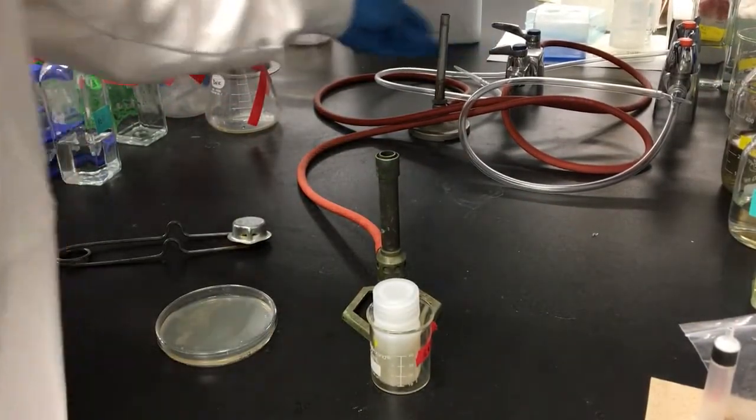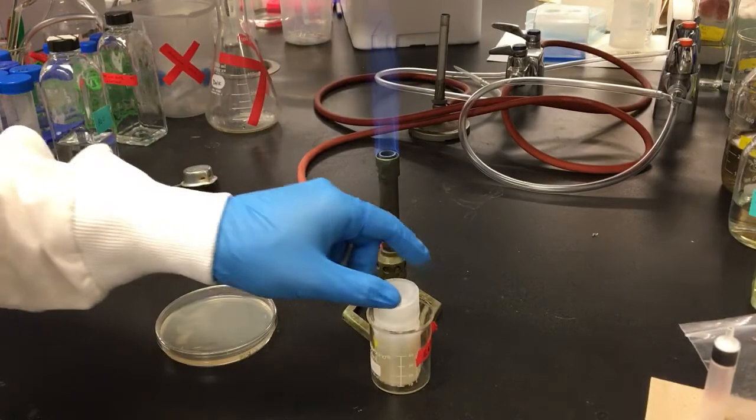I'm now going to use my spreader to spread cells from an E. coli transformation onto a plate.